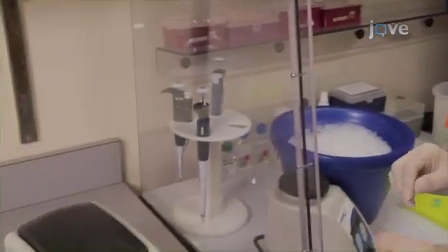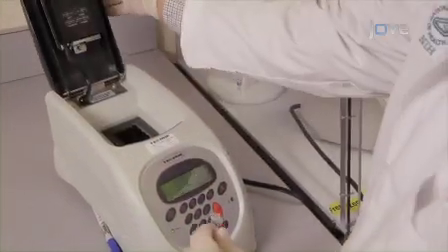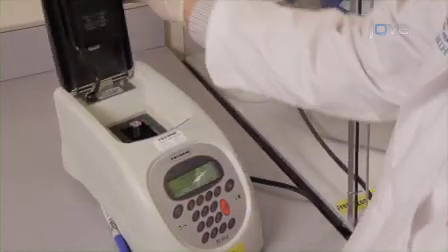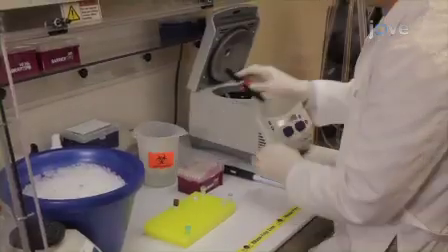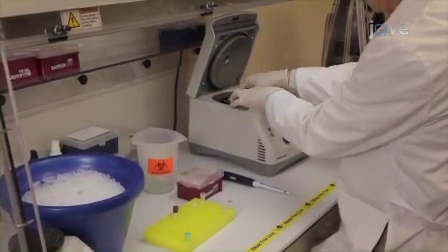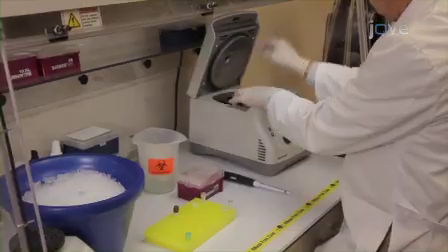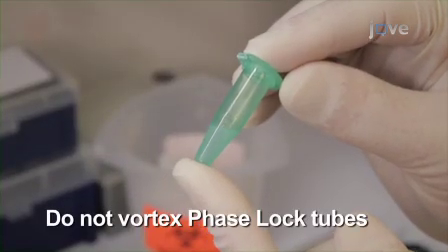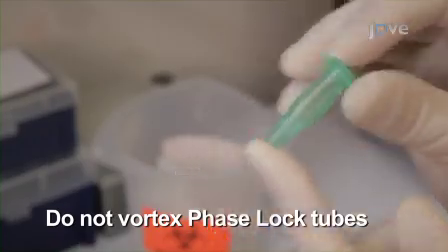To prepare biotin-labeled cRNA, the total RNA extracted from the yeast cells is first used to synthesize cDNA by reverse transcription. After cDNA generation, prepare phase-lock gel tubes for use in cDNA precipitation. Centrifuge phase-lock gel tubes at full speed for 1 minute to ensure the gel is at the bottom of the tube. Do not vortex phase-lock tubes.